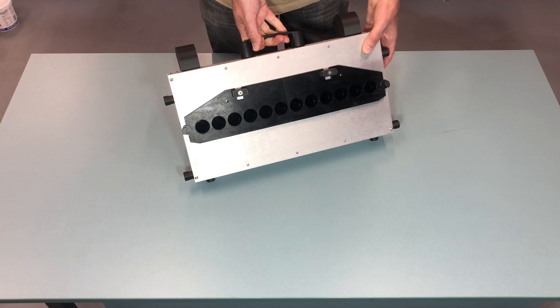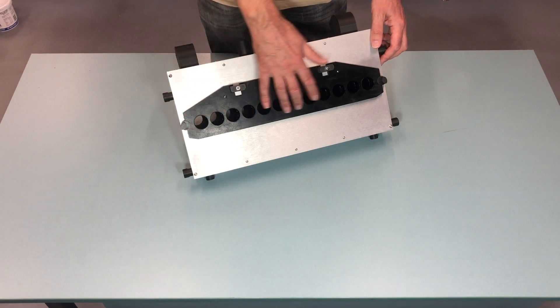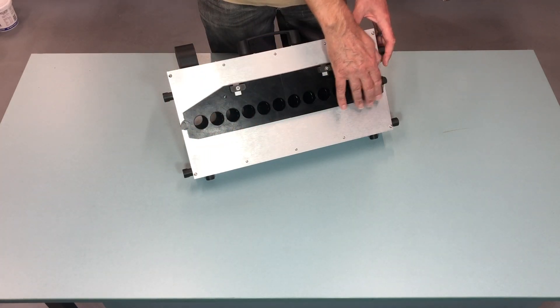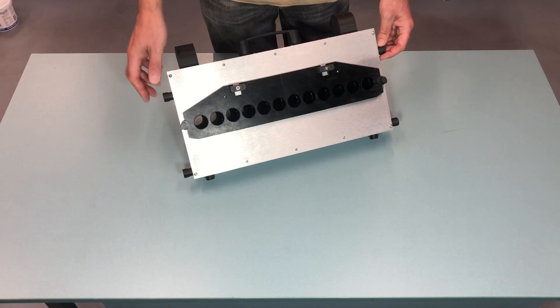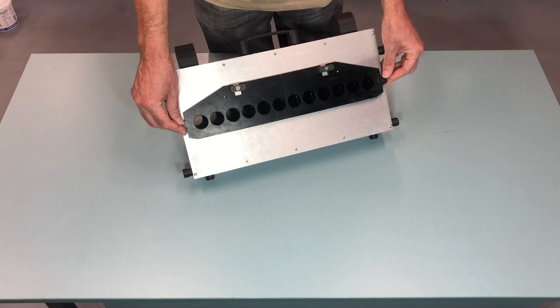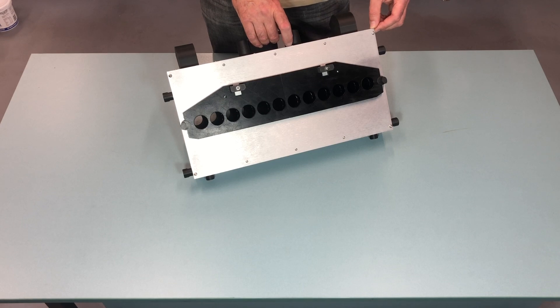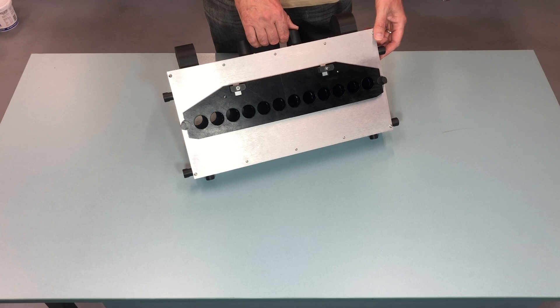Just to ensure that the rest of the upgrade is working. When the head is installed in the machine, you have to check that all these channels align with the channels on the vibratory trays, and that the trays do not run against the top of the tablet guide. So just physically check if everything seems fine. Everything is measured up using the drawings you sent, so it should not be a problem. But in case there is an issue, we just need to figure out how we are going to solve it. I expect that it should just work as is.